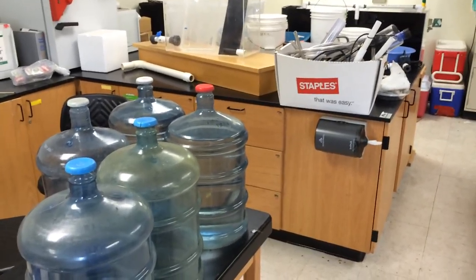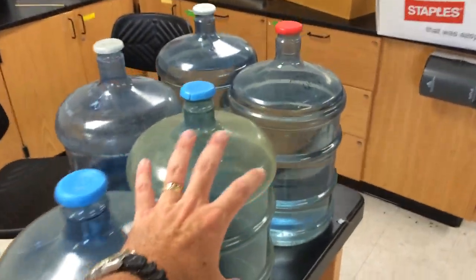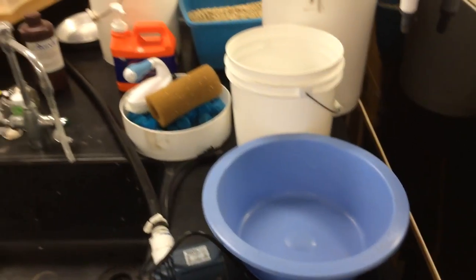All right everybody, so everything is down here in MODOK. Have several gallons, probably 10, 13 gallons of seawater.